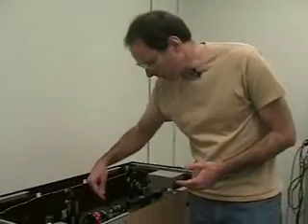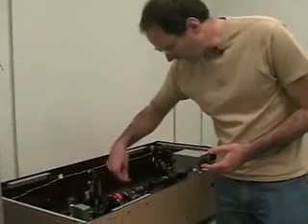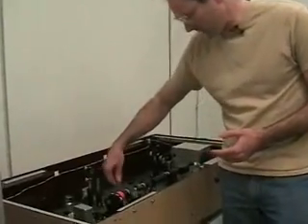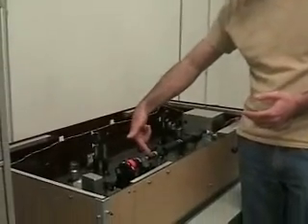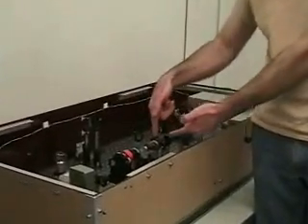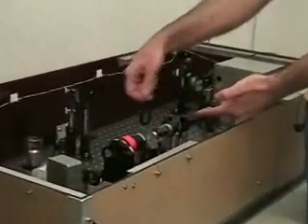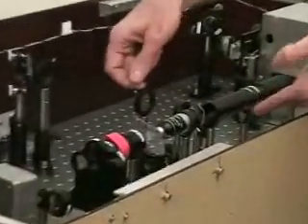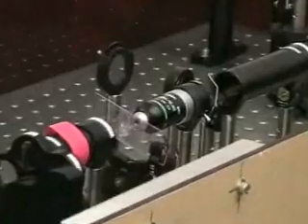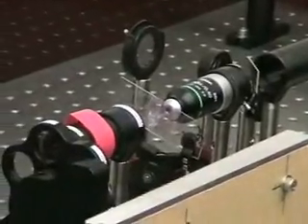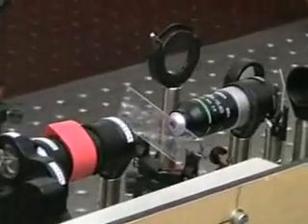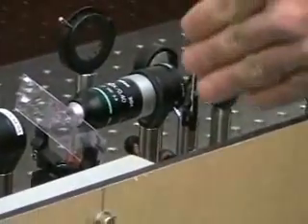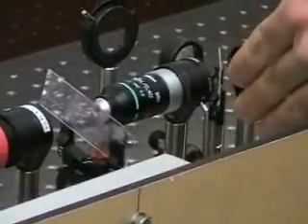So the first thing you're going to do is take one of your samples and put it into the sample holder. Now, I've actually put this sample in and I've only clipped it on one side so I can move it around easily. You don't have to clip it through both sides. And you want the cover slip facing the objective, because the objective is not designed to reach through all that glass. So the cover slip side faces the objective.